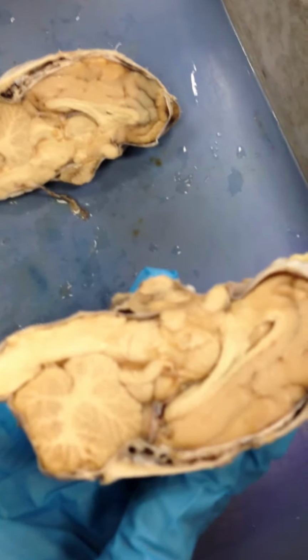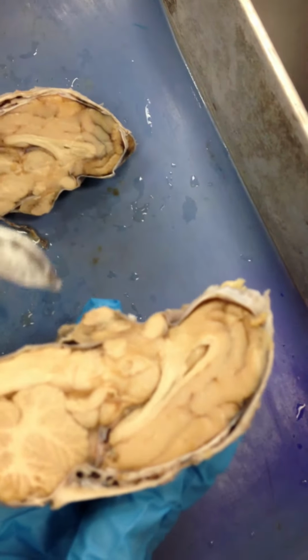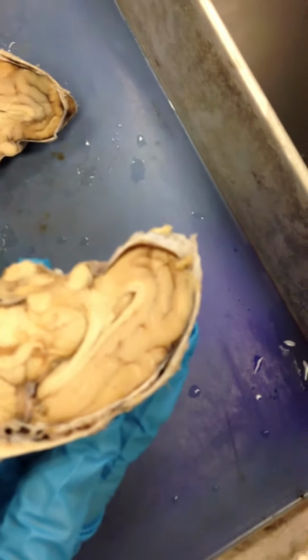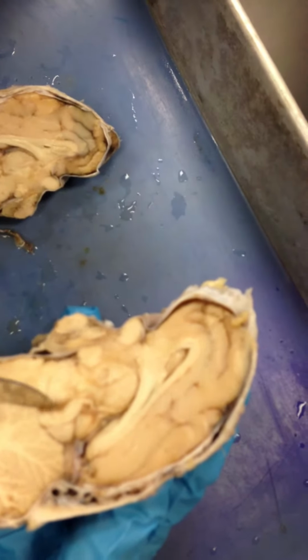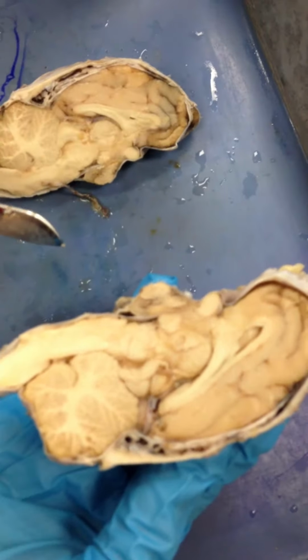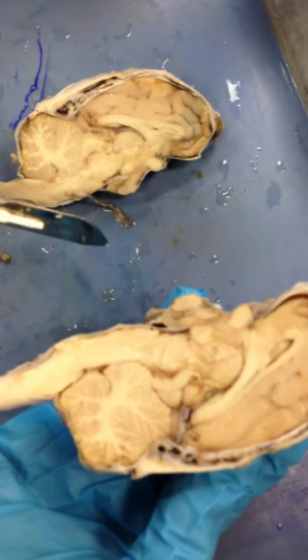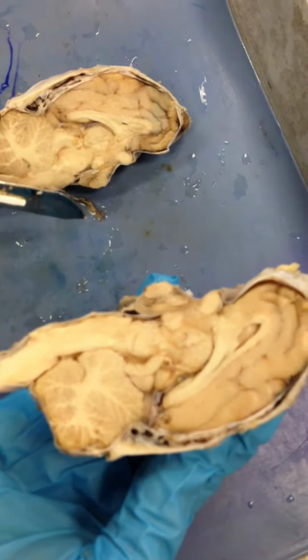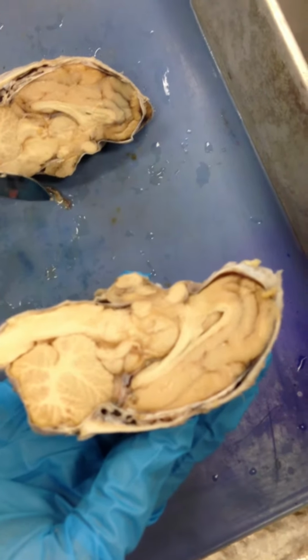Okay. So cerebral aqueduct. Is that another? The cerebral aqueduct of the midbrain. Okay, so this right here, but here's the fourth. I bet it goes under. Maybe. Yeah, see, it goes right here. It just goes in between. But this is the fourth, and this is the aqueduct right here, and then that's the third, I guess. Does it have the third on there anywhere? No. It's the lateral, which is weird. I don't see the lateral either. Dr. Clement, where's the lateral and the third exactly? It's not on this picture.